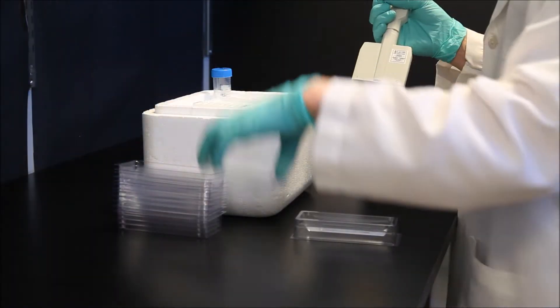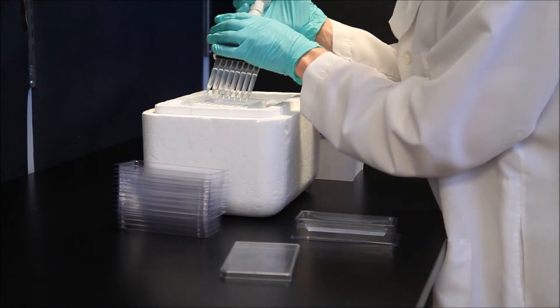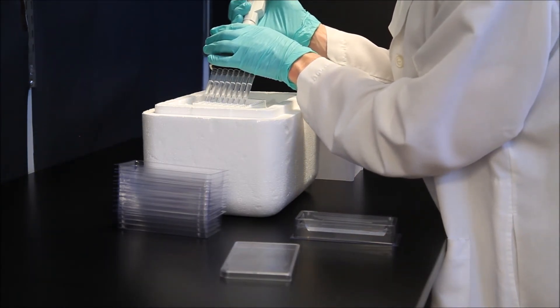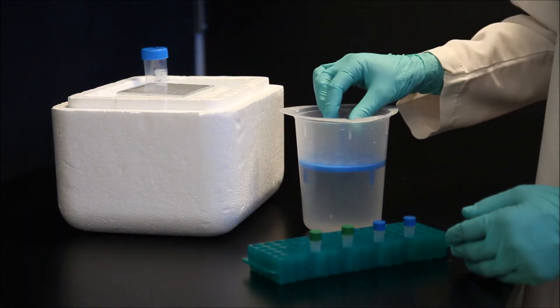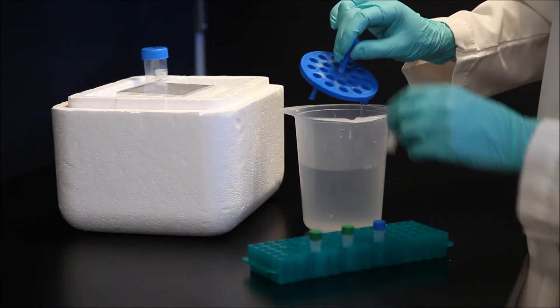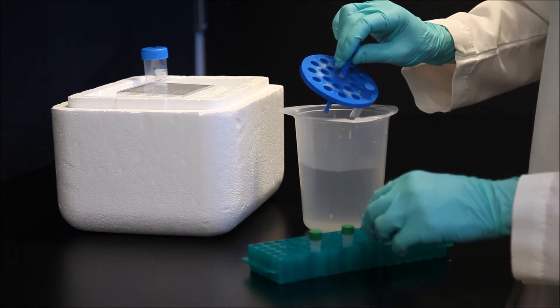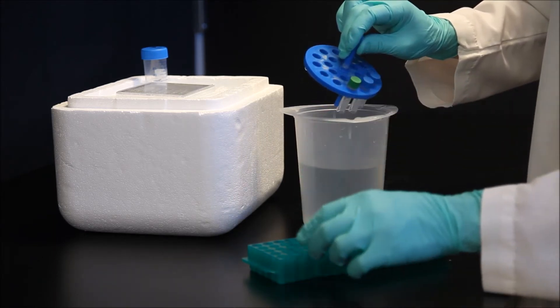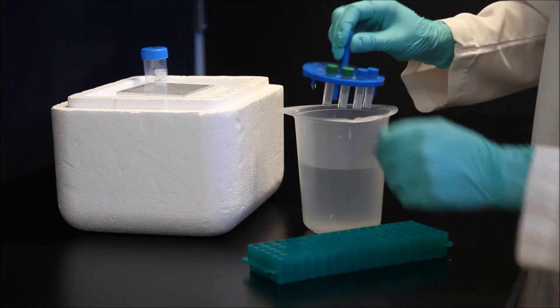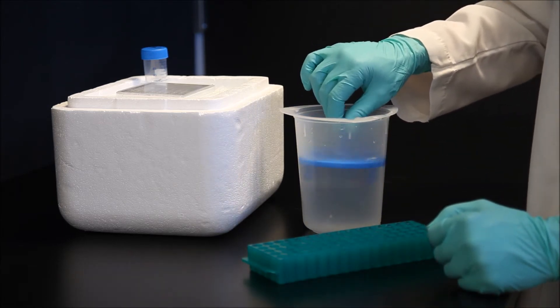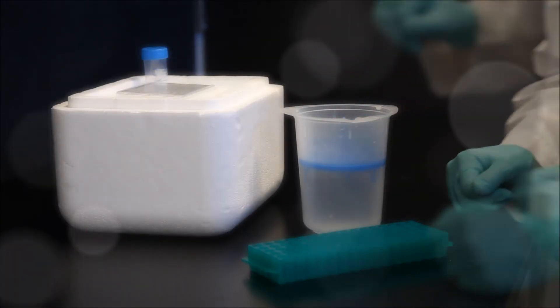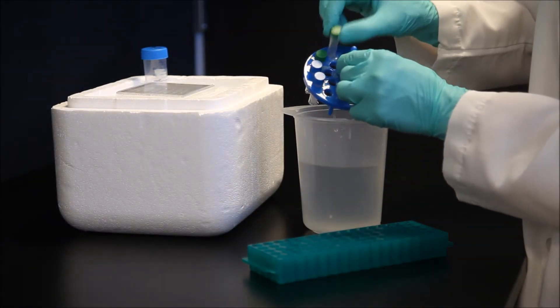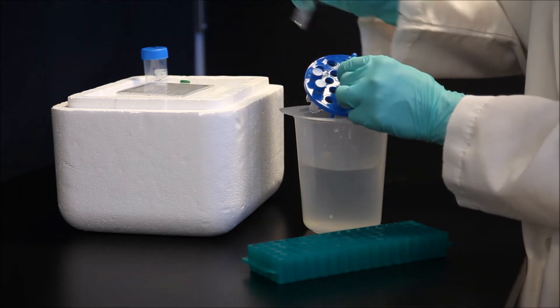Keep the wells in the strip holder on ice while adding icy cold water to each well to dissolve the protective white powder. Water should be left on for at least two minutes. After adding water to the wells on ice, remove lysates from the freezer and thaw rapidly in a room temperature water bath for one minute. Each G-LISA well requires 25 to 50 microliters of lysate using a recommended lysate concentration between 0.3 to 1 milligram per milliliter depending upon the small G protein being assayed. Specific recommendations can be found in the kit manual. Place the thawed lysate on ice and use immediately.